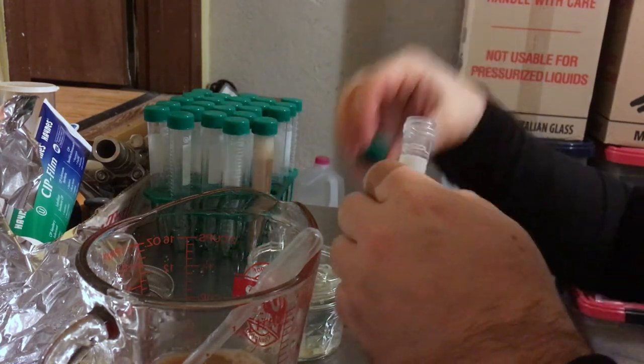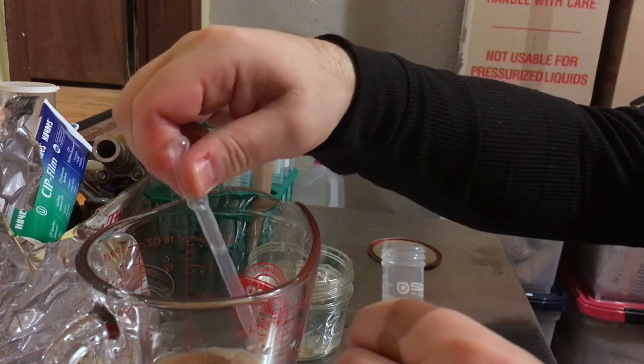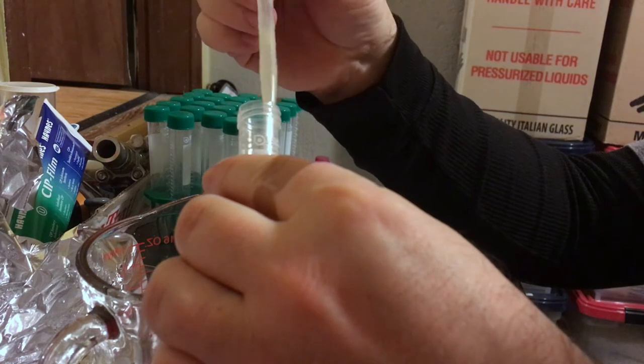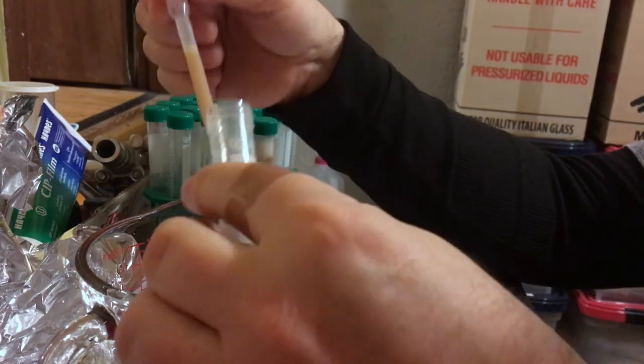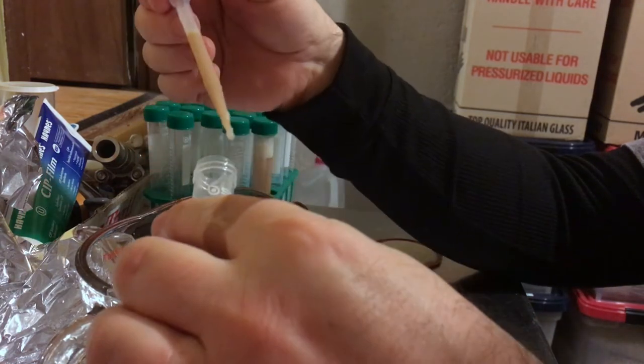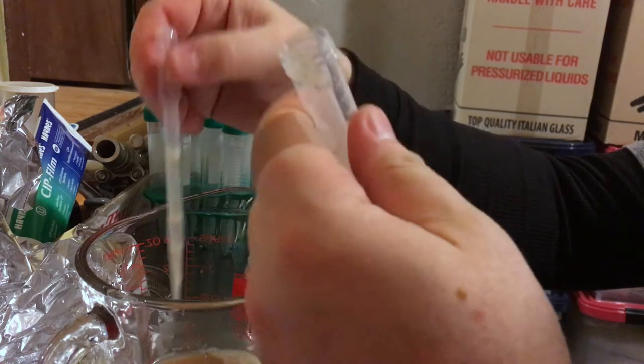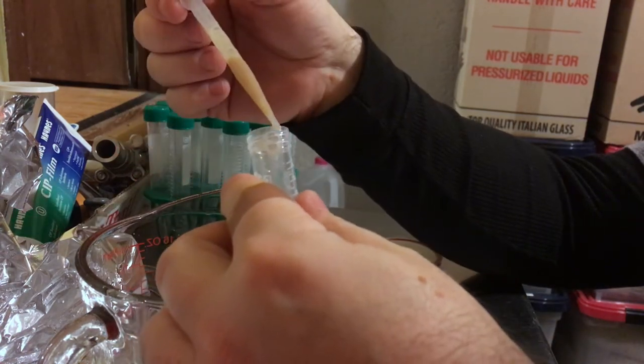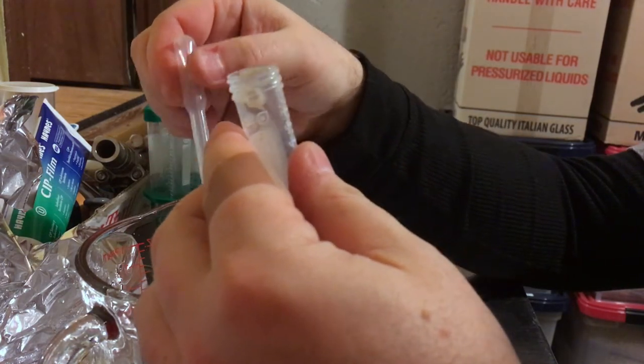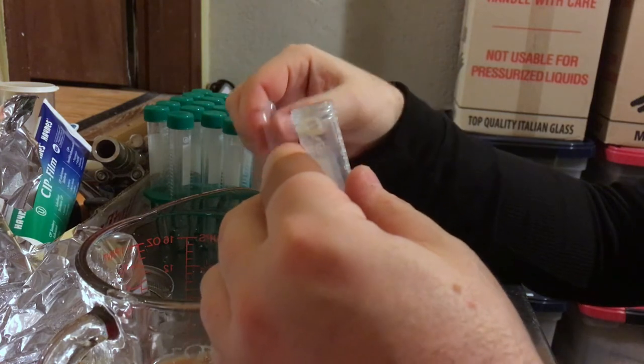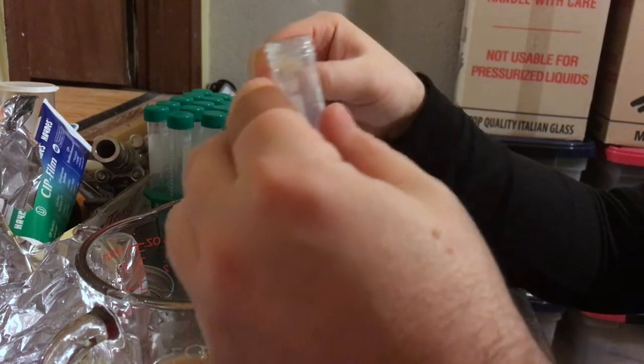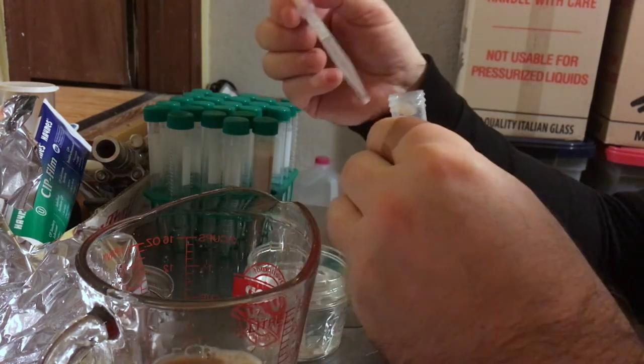If you're curious about this and you go read the article that I'm going to be posting, there are multiple methods mentioned for yeast banking. I chose this one because it seemed like the best mix - you get to keep your yeast for supposedly two or three years and you can stockpile quite a bit away.